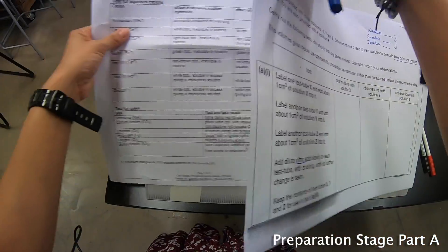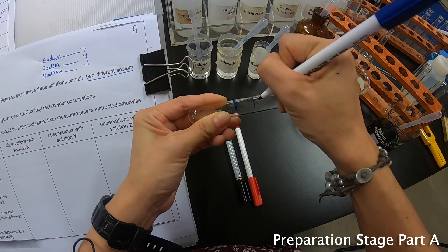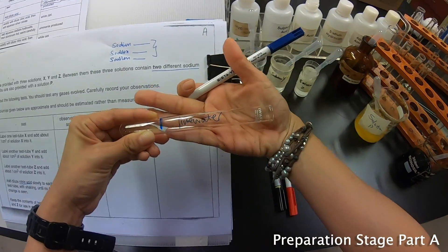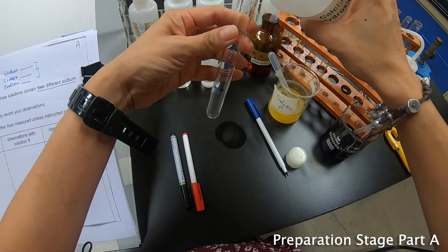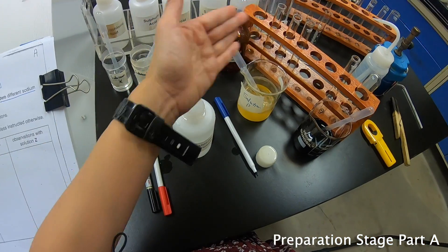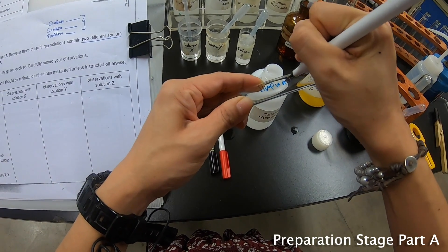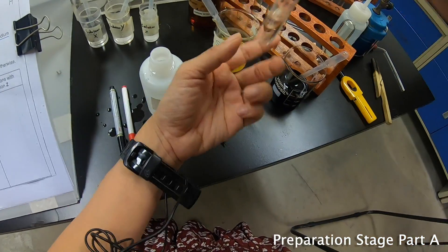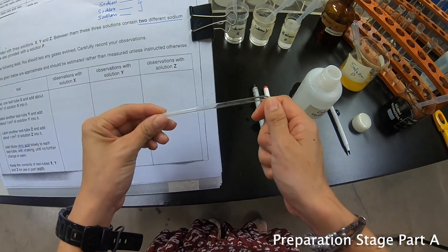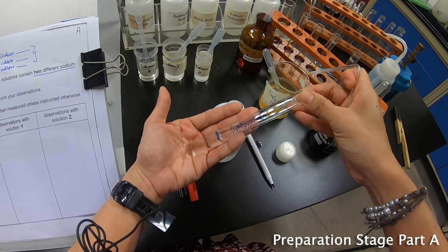I'm going to prepare lime water — about one third full of a test tube, which is less than half. I label it 'lime water' so I can see it later. Because they say two of the salts are repeated, I will prepare two sets of lime water. Because we're testing for CO2, I make sure I have a delivery tube — the long tube — that goes into one of the lime water test tubes.